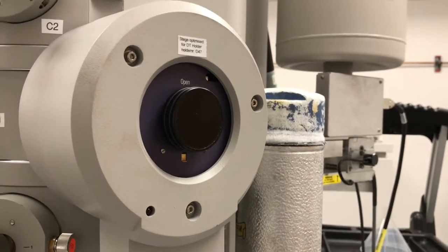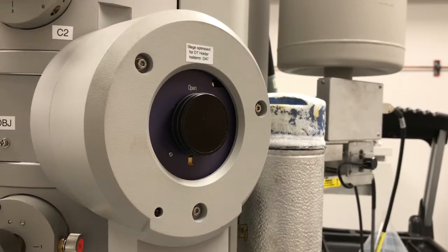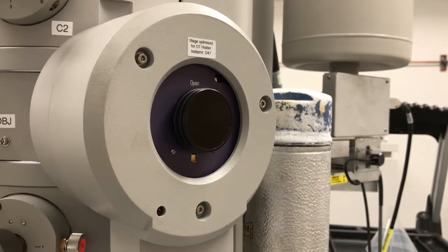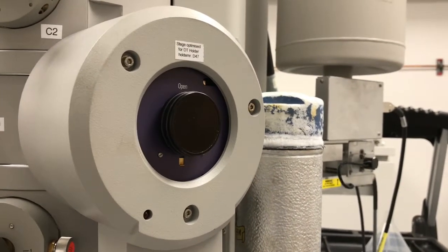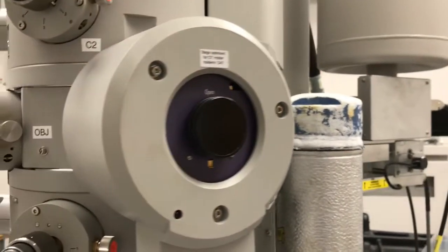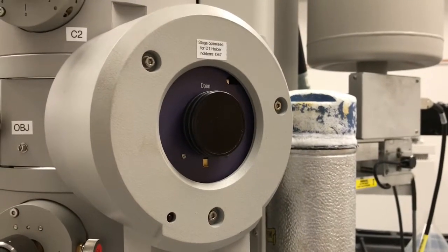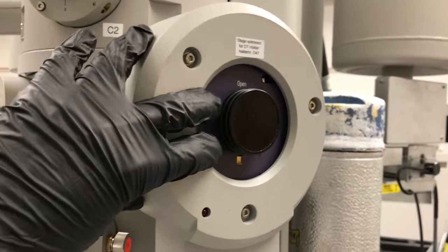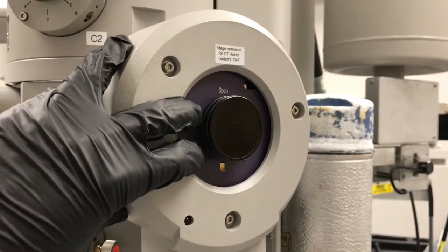Assuming you're right-handed, which most people are, that is all done with your right hand. That's not to say though that your other hand isn't participating in the process, because it is. This is something that I've seen people run into problems with.